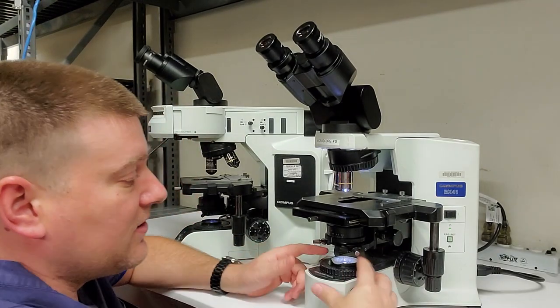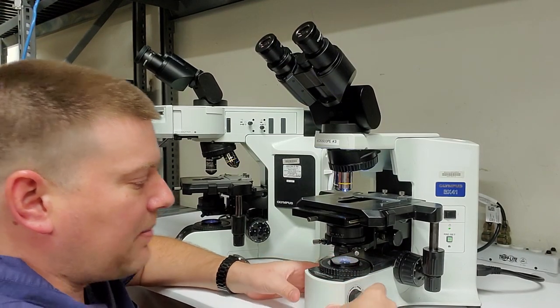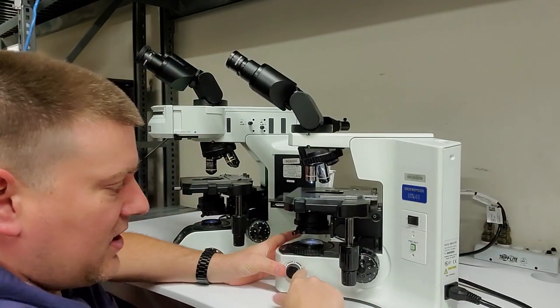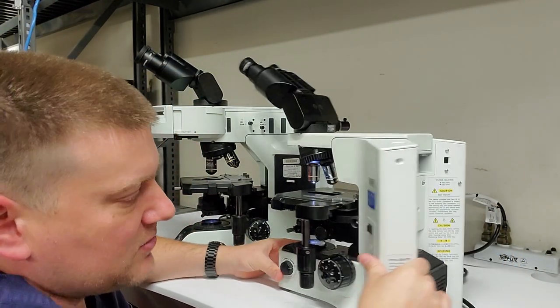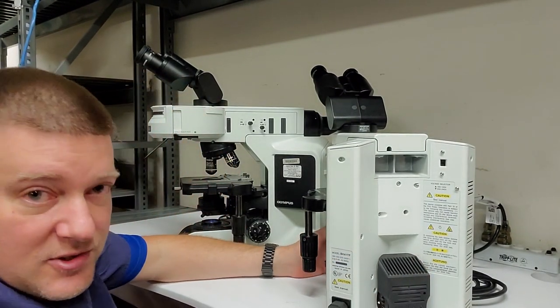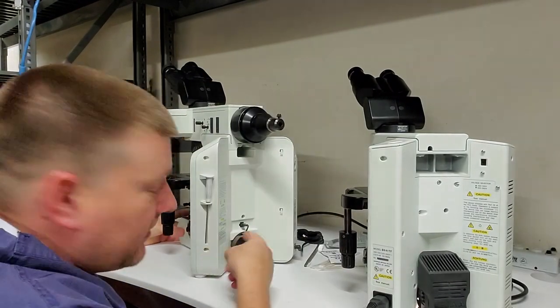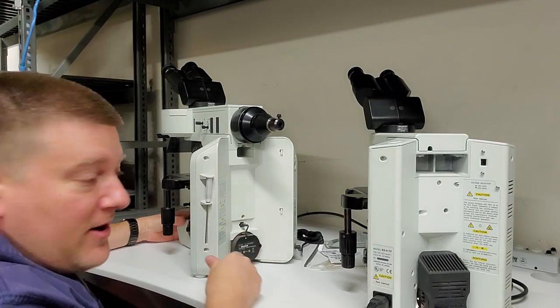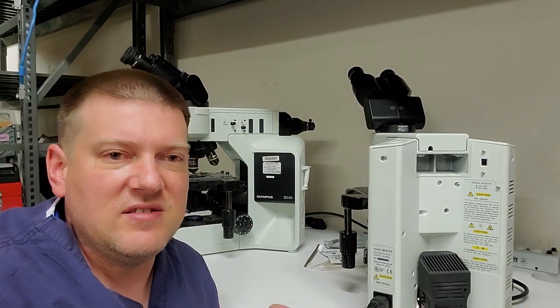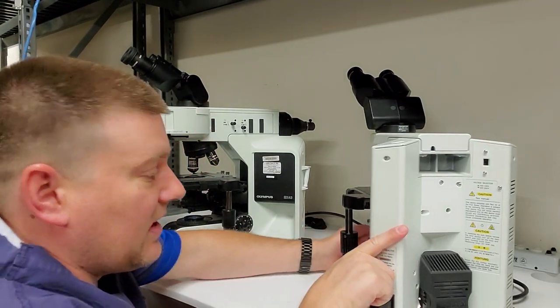So underneath this filter glass right here, and underneath your aperture, I have a dimmer, and there is a channel that comes to the back of this microscope to a halogen bulb, right here. So this is an older model. All the newer ones use an LED bulb. Very nice. LED bulbs don't have that crazy infrared intensity of a halogen. You can actually feel the heat coming off that thing, and that's the infrared.